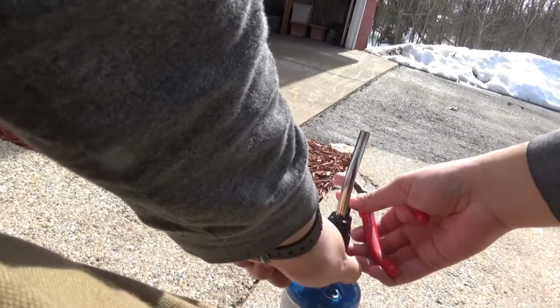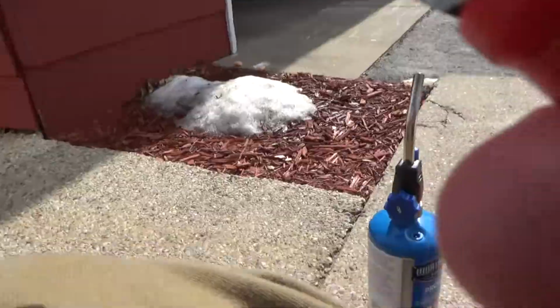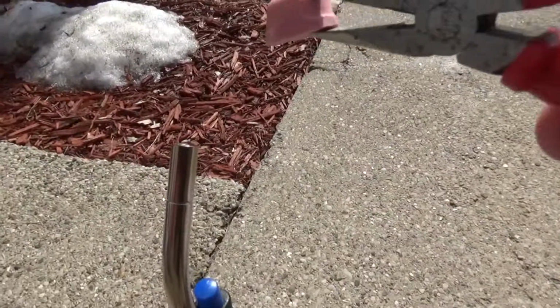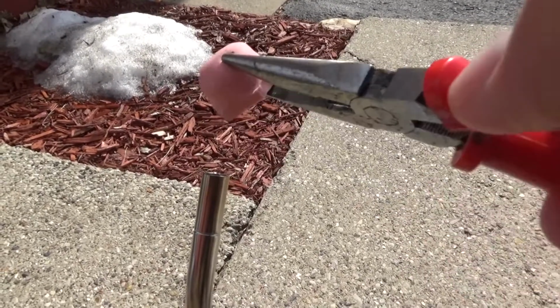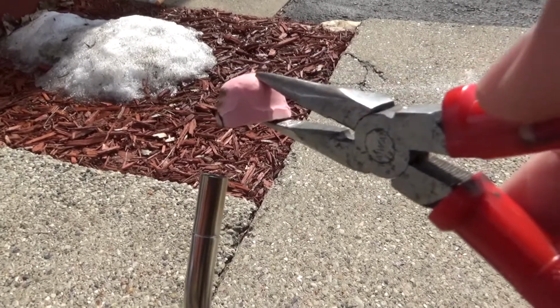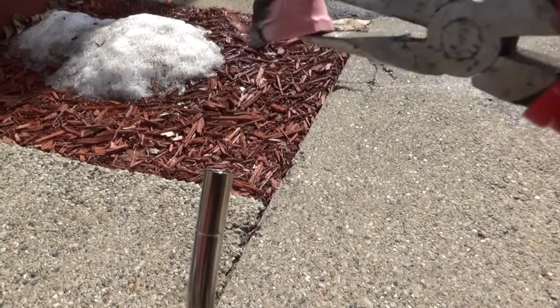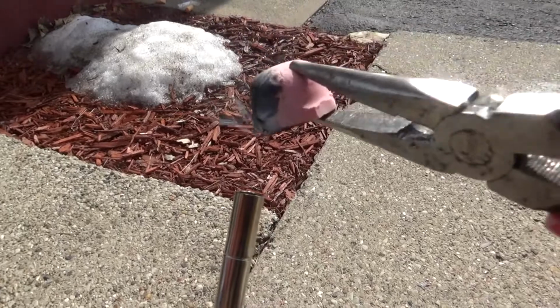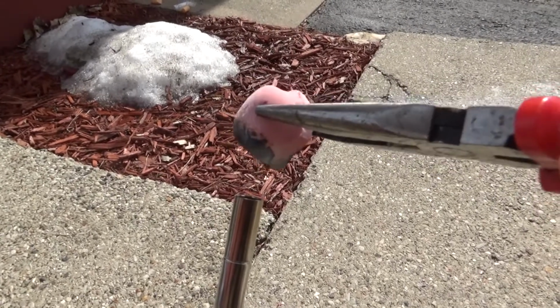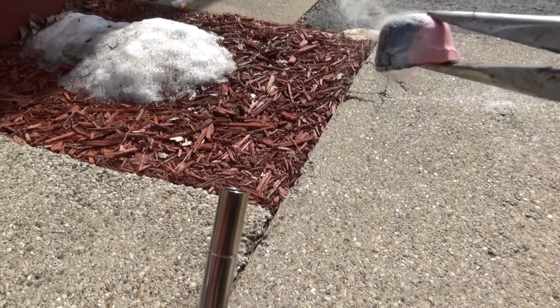So here we go. Okay, I'll start with a low heat first, relatively speaking. All right. And I'll stick her in. Okay, we have contact. Okay, it is charring a bit. It hasn't started on fire. It is smoking quite a bit, though. Oh, wait. It hasn't lit on fire yet. Kind of wants to, I feel like. Oh, there it goes.